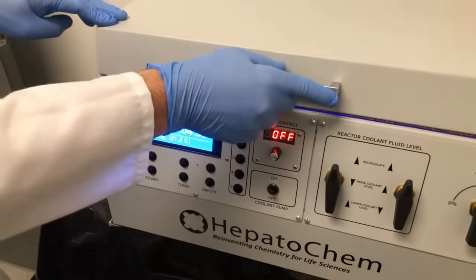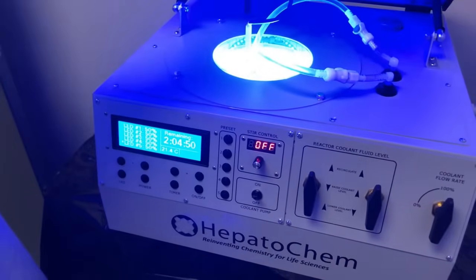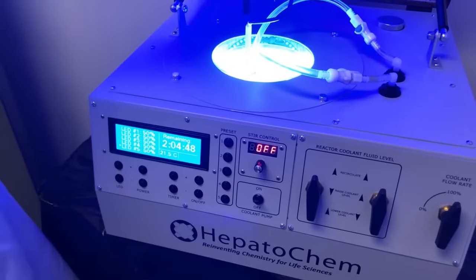We'll take a quick peek to show it's working, but please be sure to leave the lid closed while a reaction is underway, and please don't forget to wear your safety glasses.